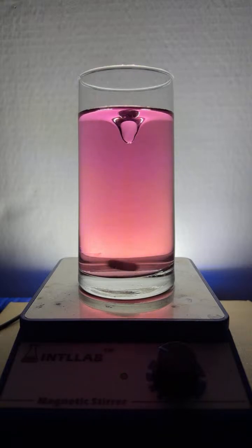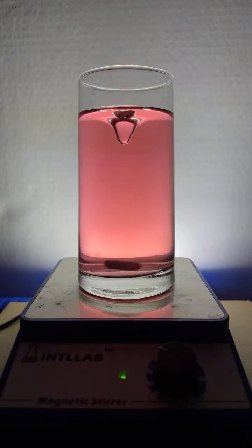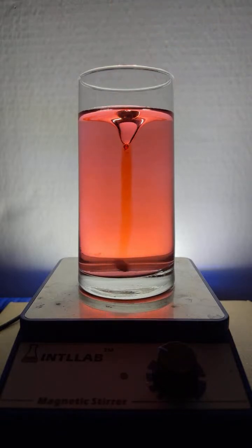And we certainly see a color shift. Look at that. Yep, definitely saw a color shift. Let's add some base. Magenta, says Tracy. Yeah, it did look magenta. Now it's kind of more like an orangish red. Let's add one more drop here just to see what we get. I'm going to add another drop of the acid just to see. I think we can get this color just a bit more red. Look at that. Nice. It's a nice red color. Again, it's coral. Yeah, Carl.